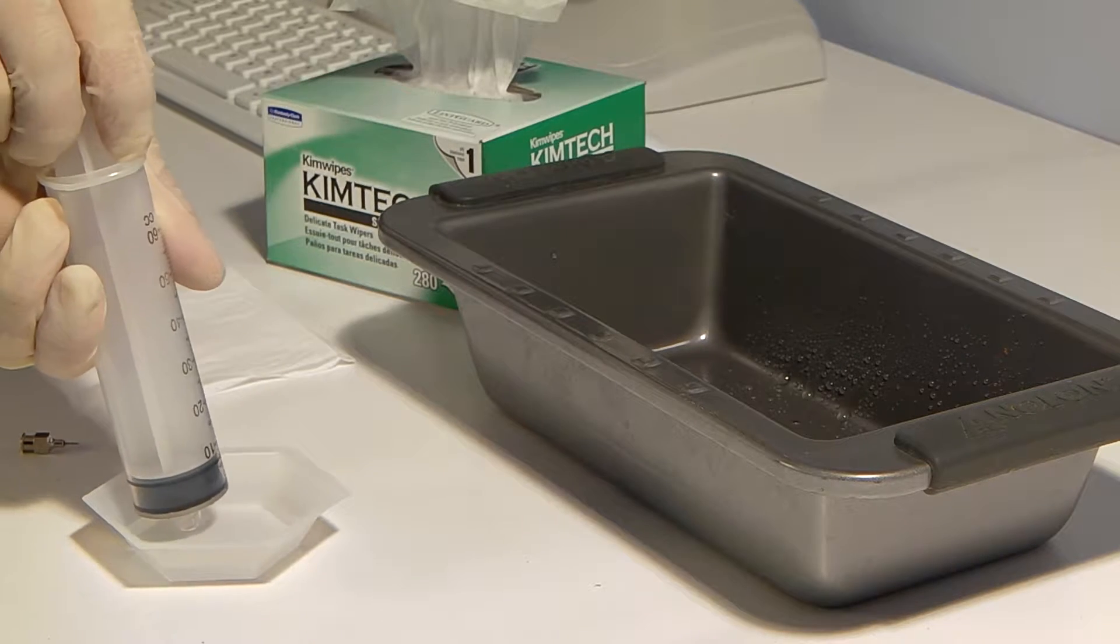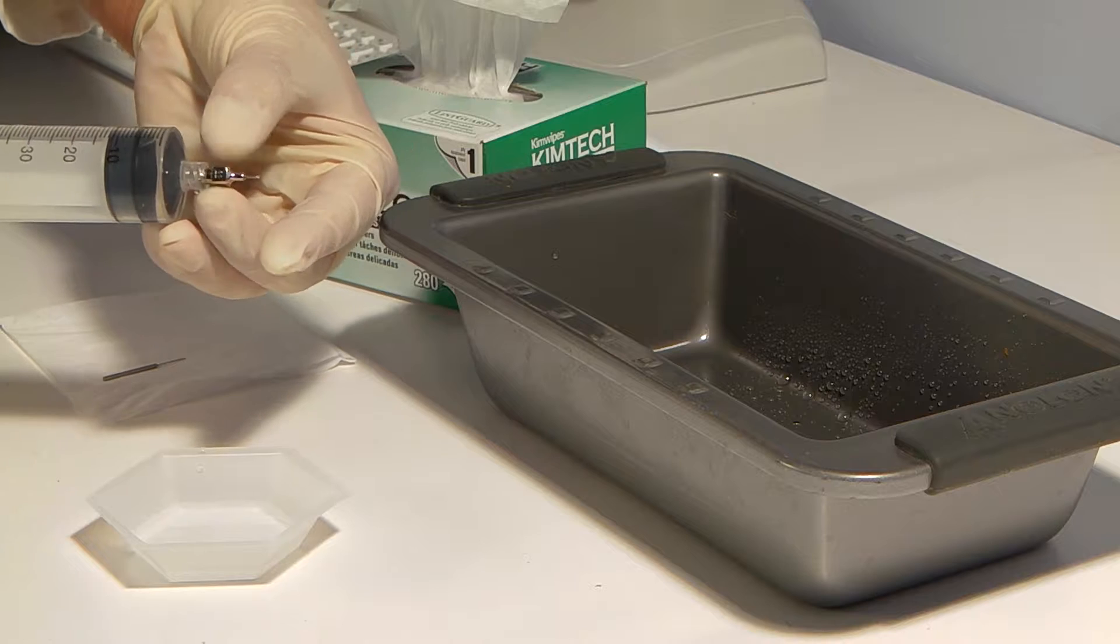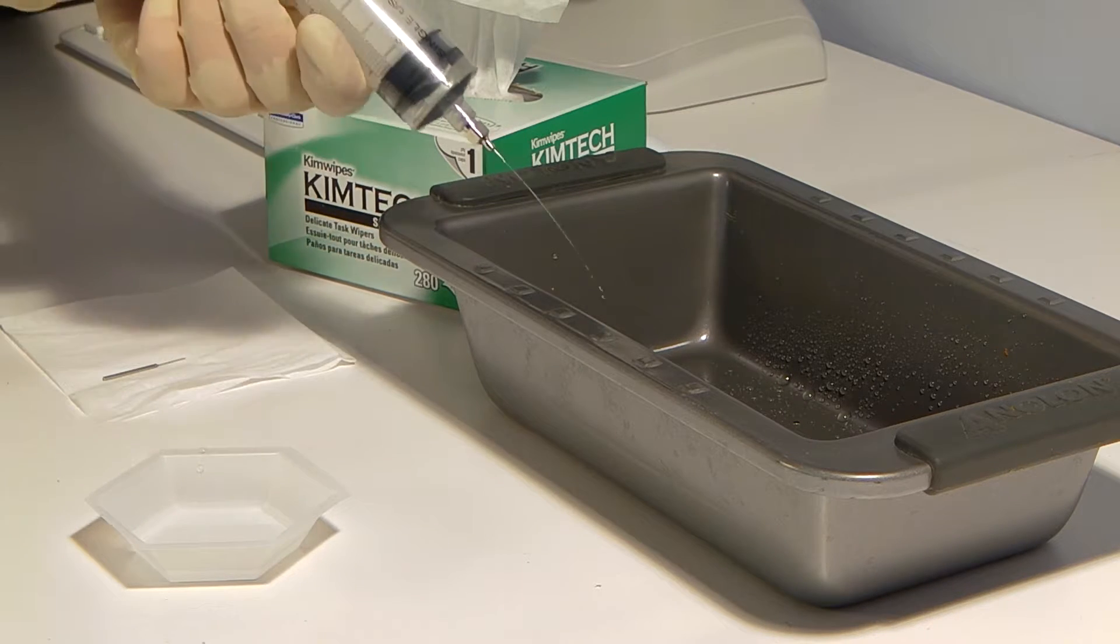Next, drop some cleaning solution into the cleaning syringe. Then, screw on the reference probe into the threads of the syringe.